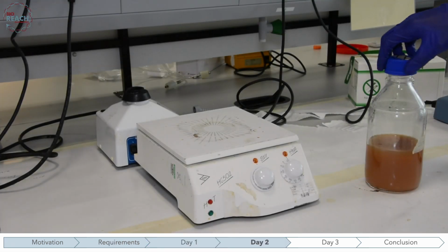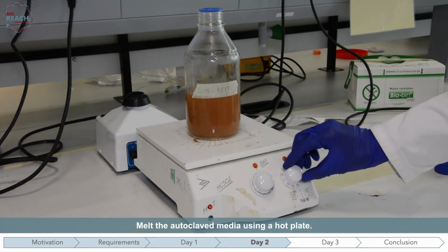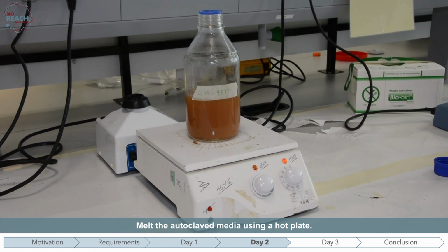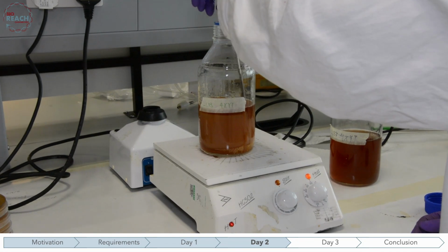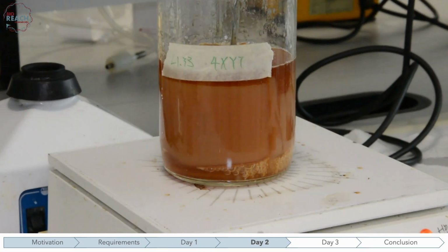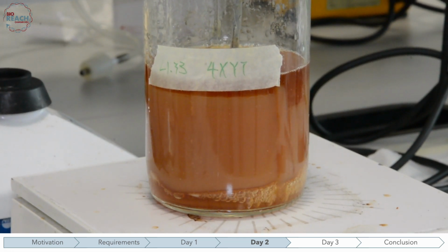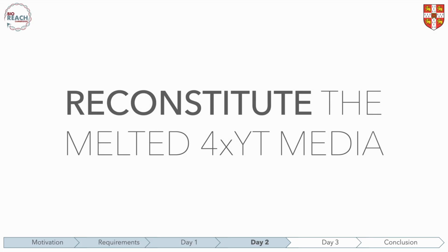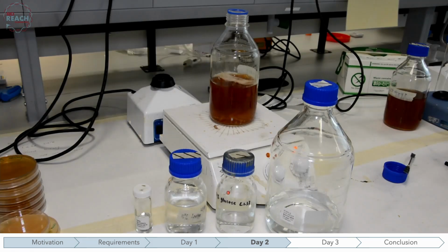For day 2, we begin by melting our agar medium. In this video, we use a hot plate, but you can also use a microwave. To heat the medium evenly and prevent it from boiling over or burning, it may be helpful to cut the agar with a sterilized metal stick or rod. Make sure the lid of the bottle is loose or removed entirely and keep an eye on the medium at all times. Once the medium is completely liquid, remove it from the heat and allow it to cool slightly so that it is safe to handle and no longer boiling.